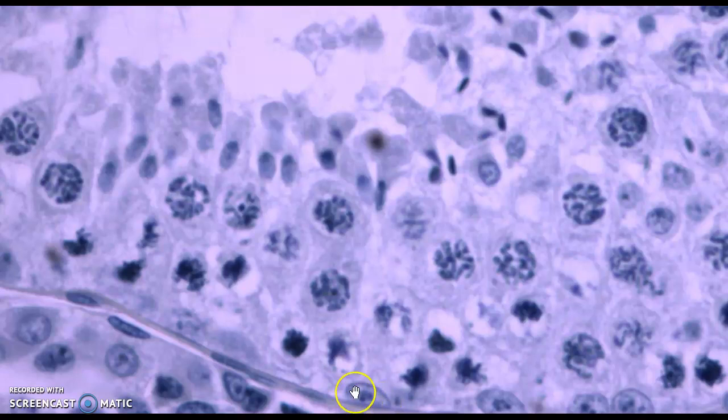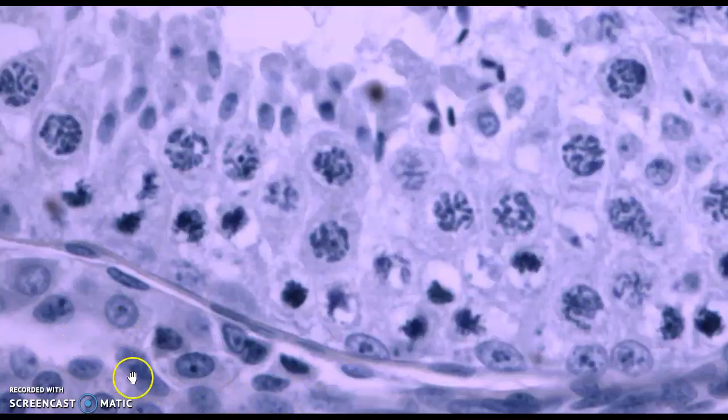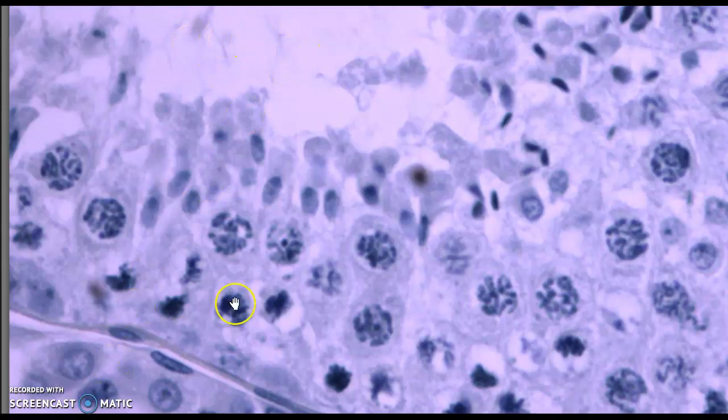So here we're blown up. These cells right here are the Sertoli cells. And if I scroll down a little, these are the interstitial cells that are making testosterone. So these up here are going to be spermatogonia. They're going to be starting meiosis, becoming haploid cells, and they're working their way up. And as you can see, the cells are getting smaller and smaller. So see how much smaller those cells are, until we have these spermatids in the center here.